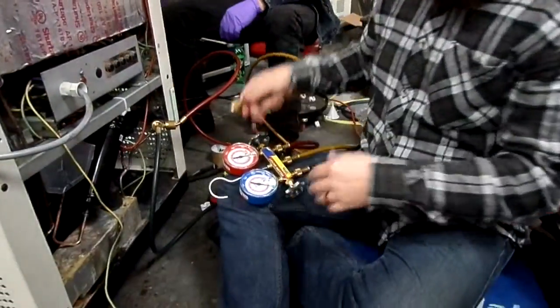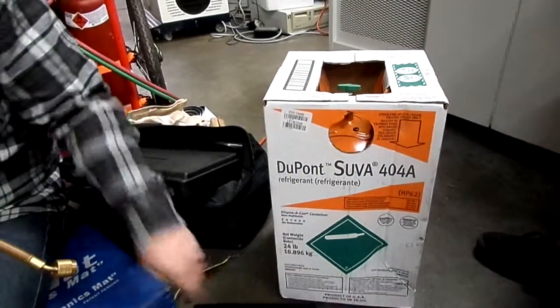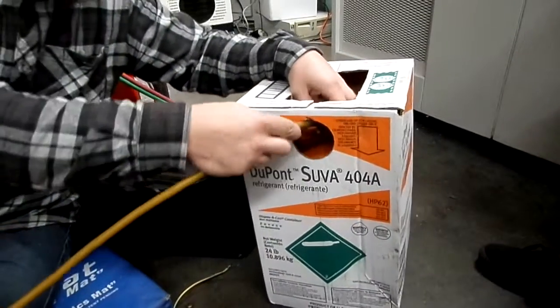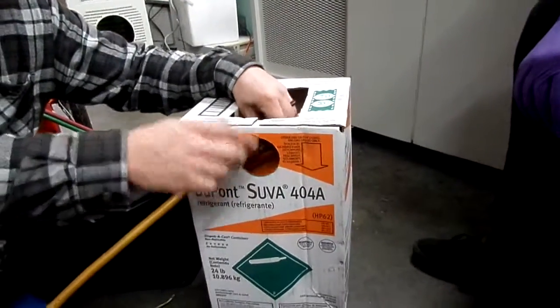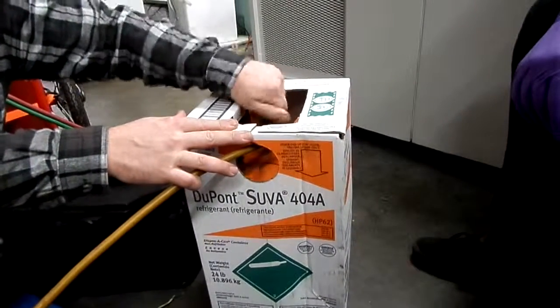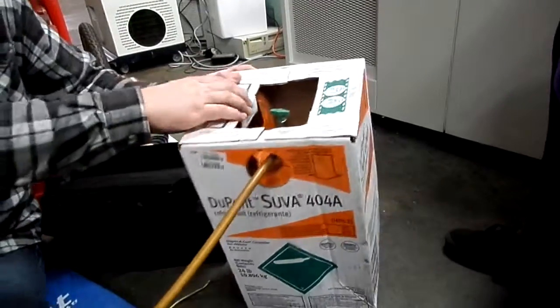So with your gauges closed, you're gonna hook up to your Freon tank. Hook it up when it's upright. And again, your gauges are closed. So pop the tank open while it's upright. And that'll fill the yellow hose up with vapor, which is very lightweight. It won't add to the charge at all.